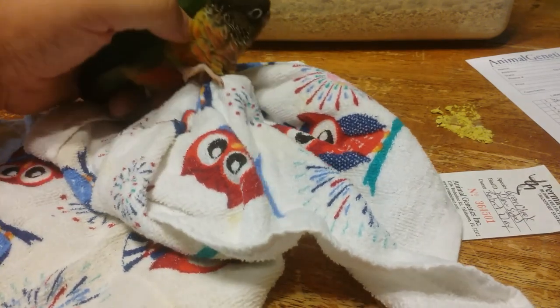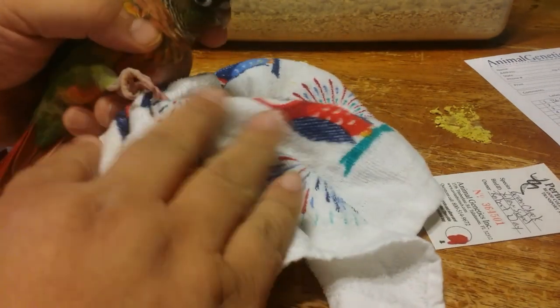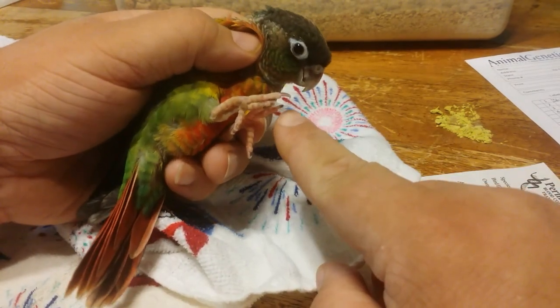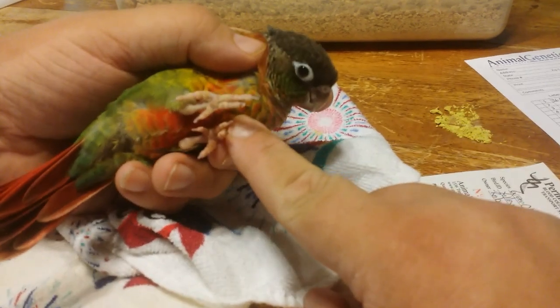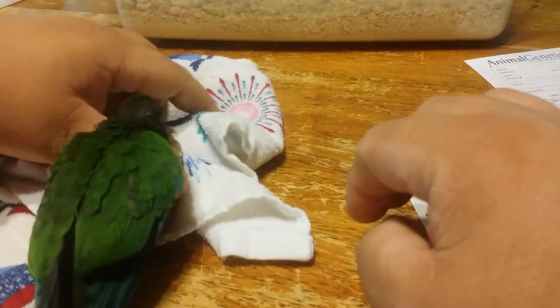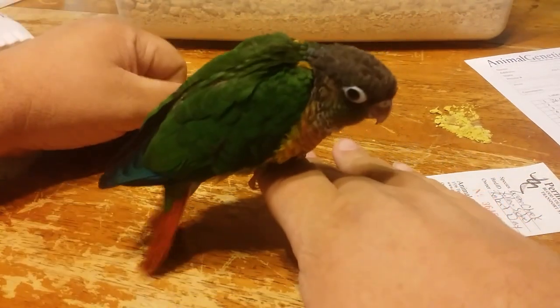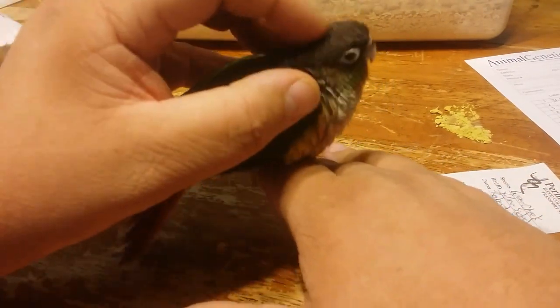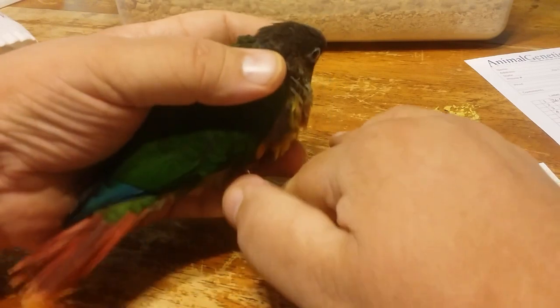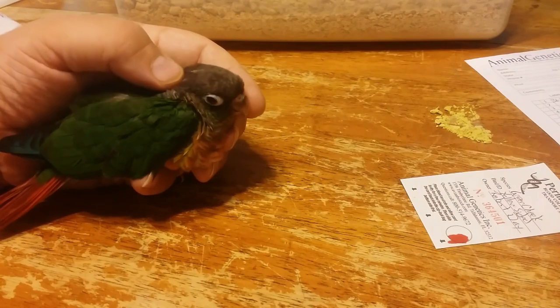Let's see your toe. We don't even know which toe it was anymore, do we? It was this toe right here and you can see it's not bleeding. It's no big deal — the little bird is perfectly okay. He is calm, he is perching. So we're going to send this in and we're going to find out if this is a boy or a girl. And it's just that simple.